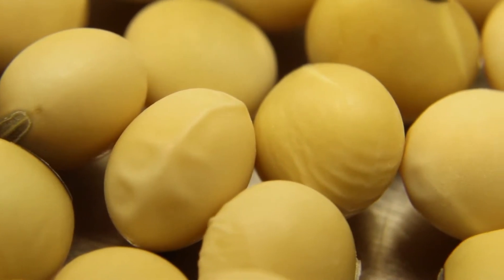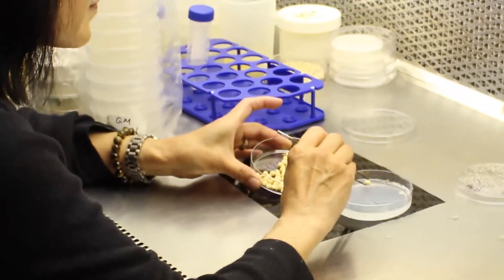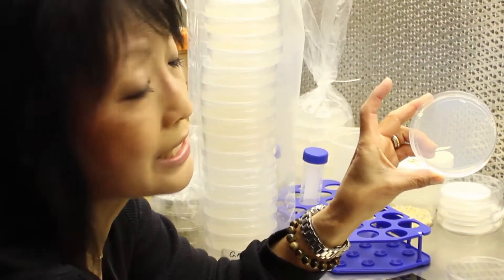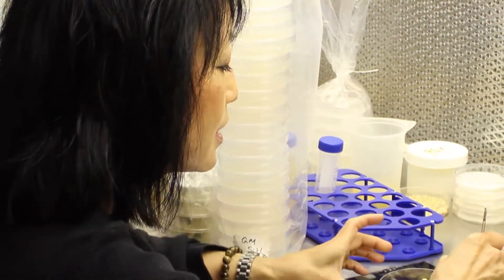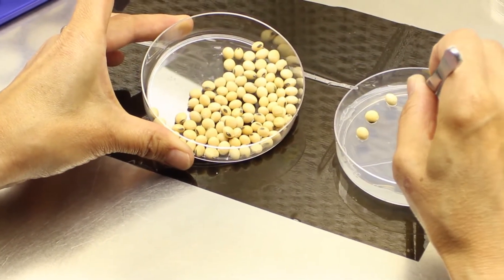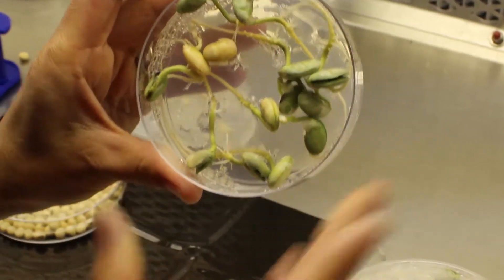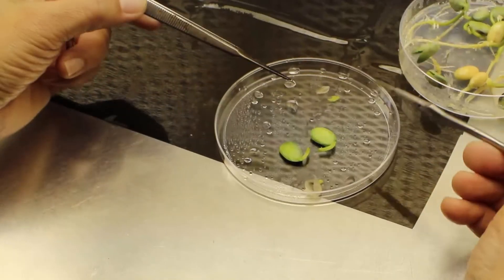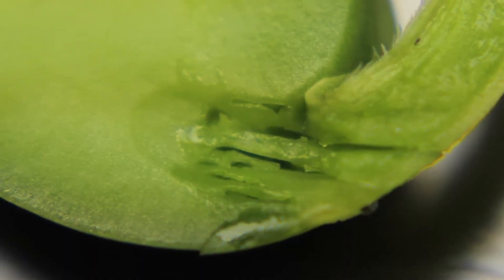I have some seeds here. I place these seeds on plates containing media which contains all the elements necessary for growth. After five days, this is what the germinating seeds look like.